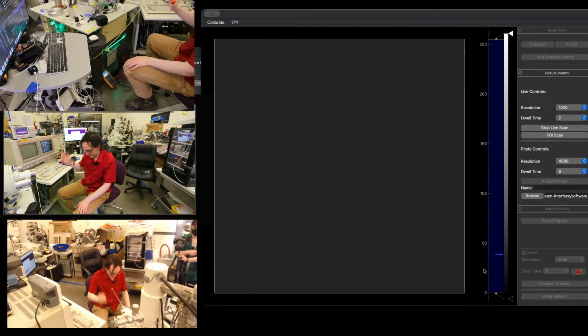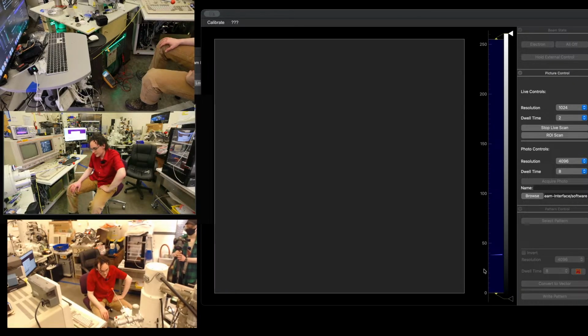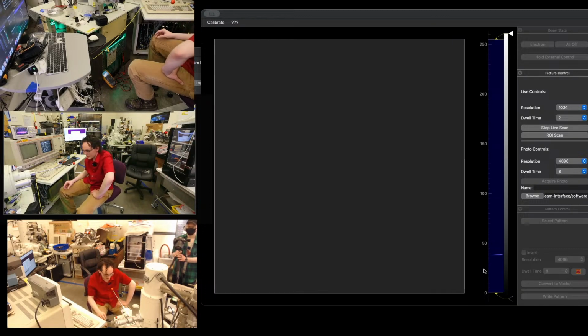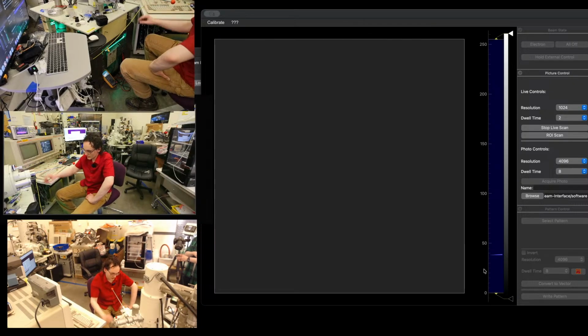Well, it's not dropping. Let's see if we're at 0.151 still on PG2. No, that went down actually quite a bit. Okay, so let's let the load lock cycle happen. So it seems like we have a leak in our load lock door. That's fun. Yeah, never seen that before. We were load locking samples before the stream and everything. That's really funny. So there's probably contamination on the inside of the load lock door.